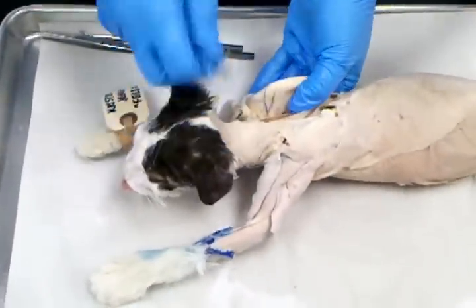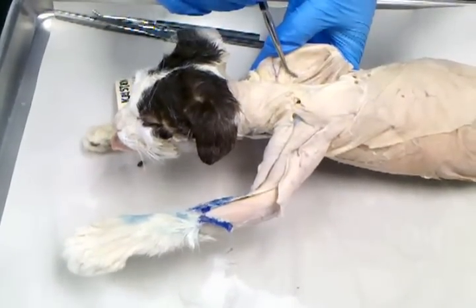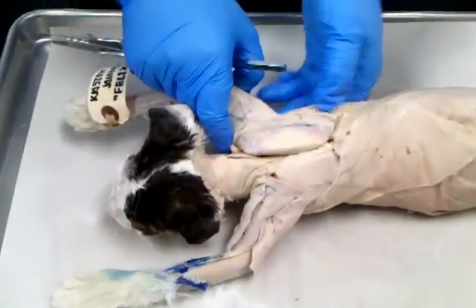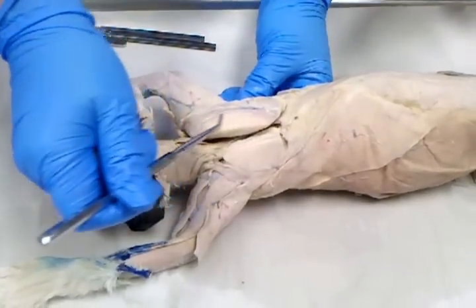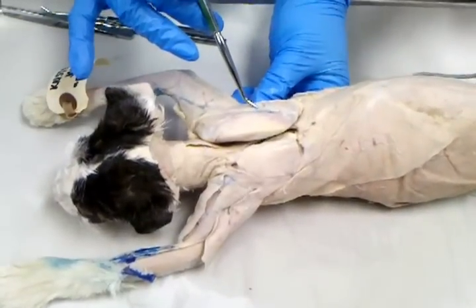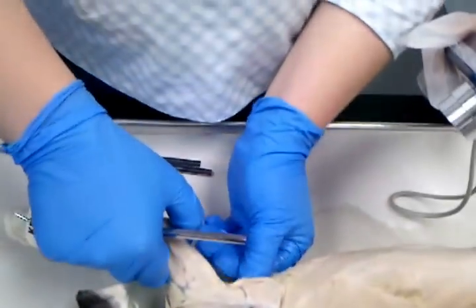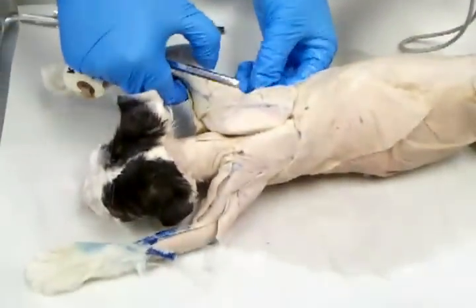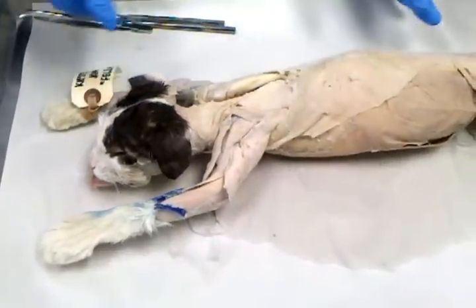Now, on the bottom side of the scapula, you've got a muscle right here. It's called subscapularis. Okay? All right. So, on the outside of the scapula, you have 3 deep muscles you need to know. You've got supraspinatus, which means above the spine. Okay? You've got infraspinatus, which means below the spine. And then you've got teres major, which is this little chunky muscle on the bottom edge of the scapula. Okay? All right. So we're done with thoracic muscles.